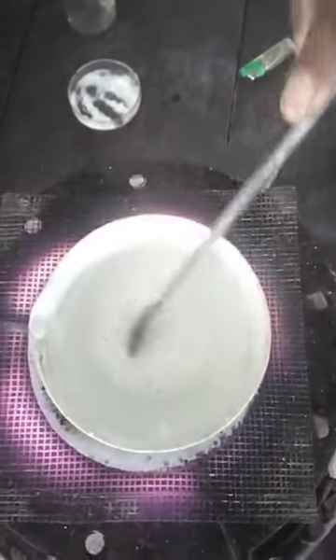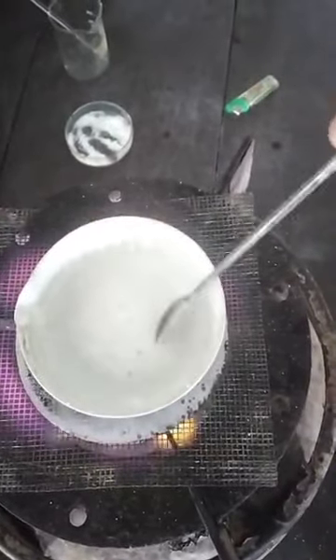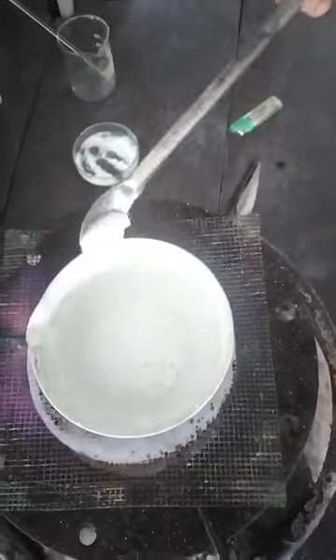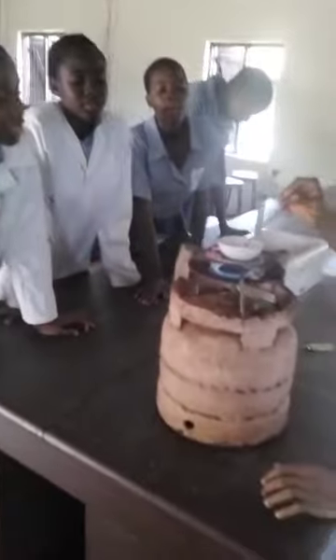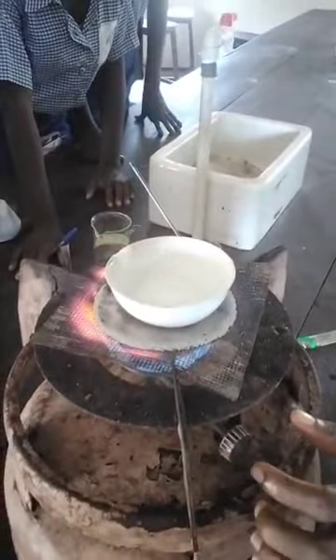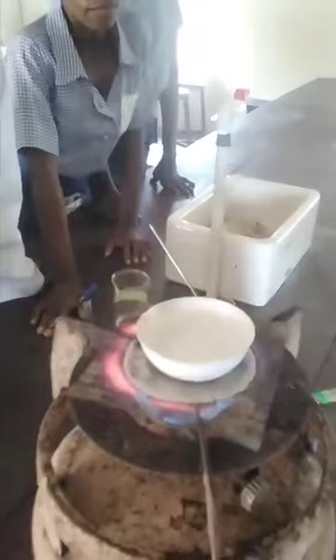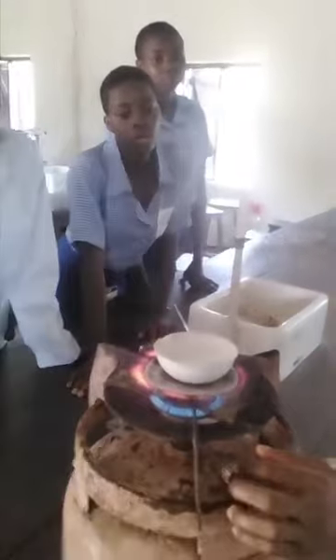Can you see now? You see, the water has evaporated. It's just remaining small, and we'll have only salt. Can you see it? Okay, so this is evaporation to what? To dryness. Evaporation to dryness. Okay. So what will happen is, as the water evaporates, we'll turn off the gas, and then we'll allow it to get cool, okay? And once it gets cool, we'll get our salt back.